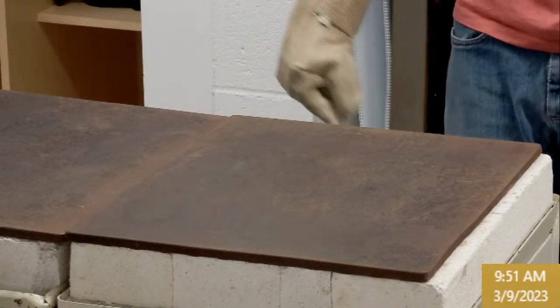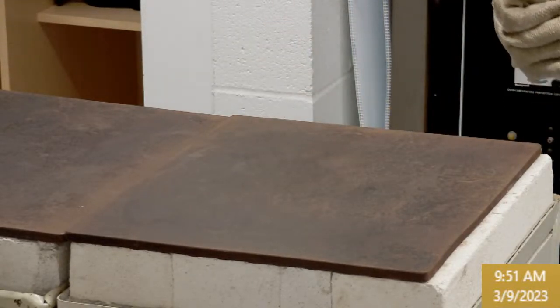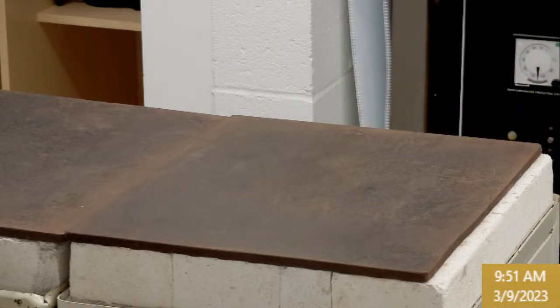So it looks like 85 silica. There is 5 grams of borate. I'll add that to the table. That exact ingredient wasn't there. We usually just include that one here. And then some washing soda, crushed limestone. So these are some interesting source materials, not just the straight stuff. Copper oxide, so we'll have a copper blue, lower viscosity glass. All right, so let's pull K.